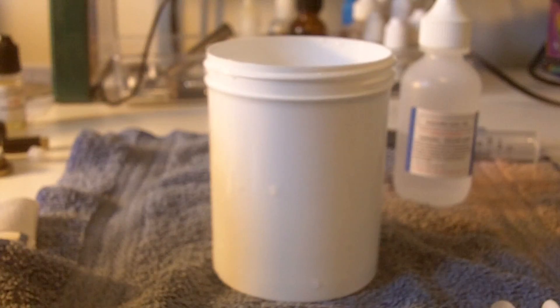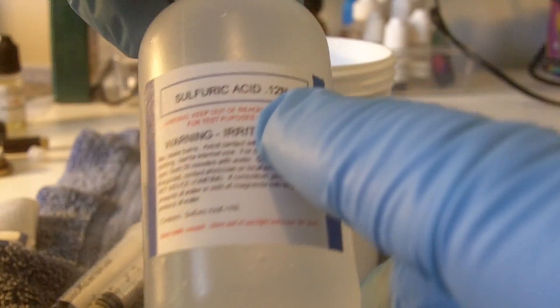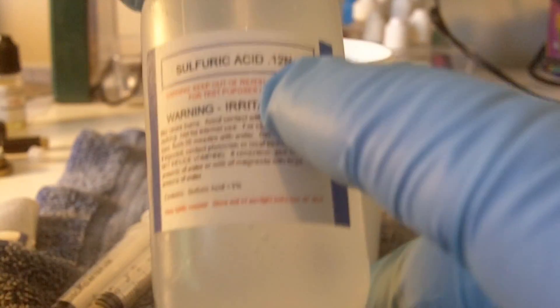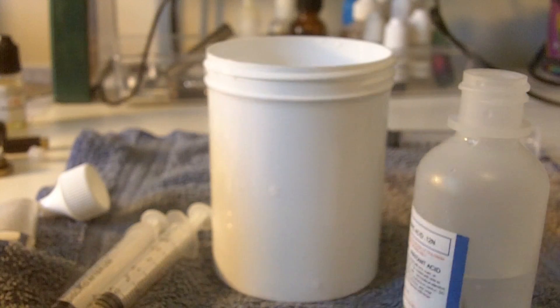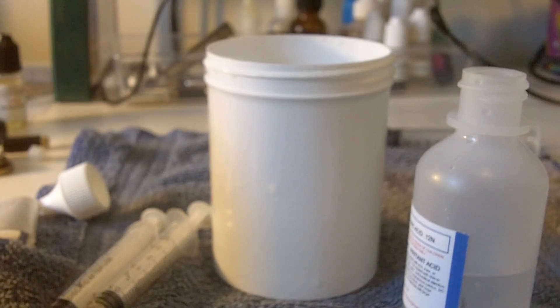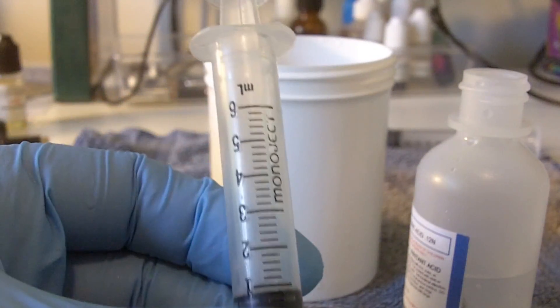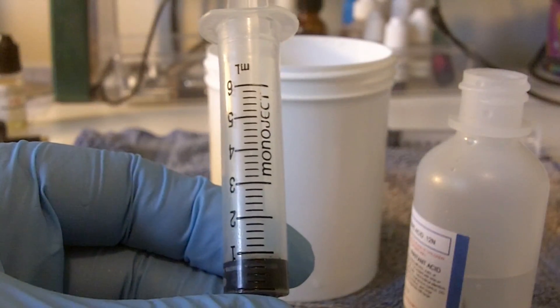The next step is to carefully measure out small doses of sulfuric acid. Sulfuric acid is a corrosive — this is diluted down to a safe level. If you were to source this yourself, you want a concentration down to a 0.12N level, which is the strength of the acid. To speed this up for the video, I happen to know that for 100 milligram nicotine, the conversion means we should be using approximately 15.4 milliliters of the acid. I'm going to jump straight up to 10 milliliters by using a separate syringe and pulling out five milliliters at a time.